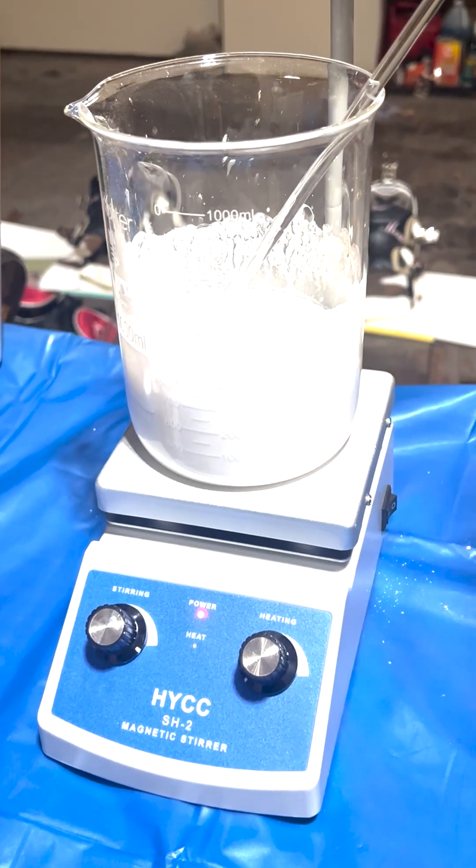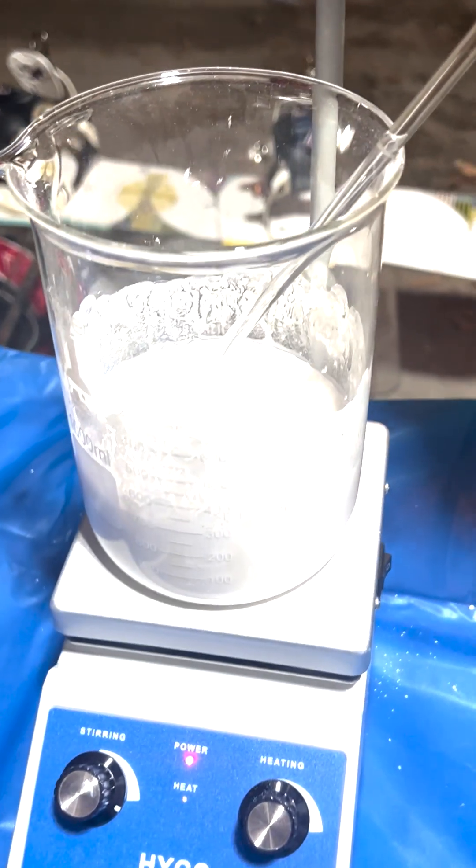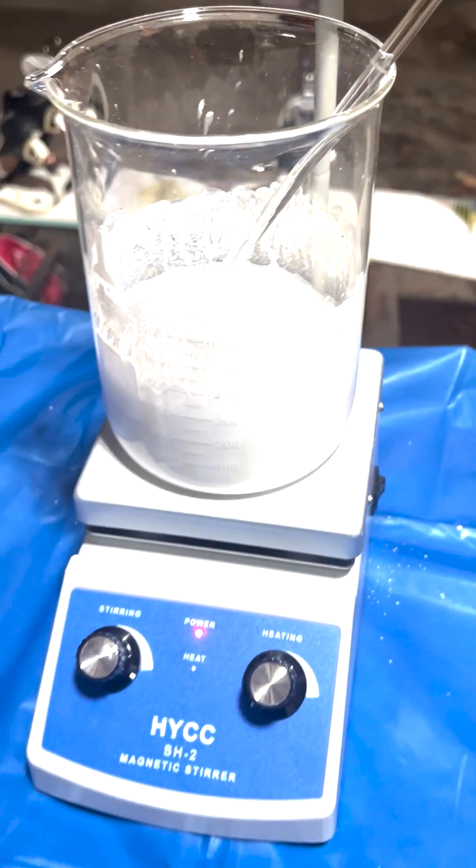And we're going to let it run overnight. Hopefully, this foaming will stop and then we can boil it and reduce.